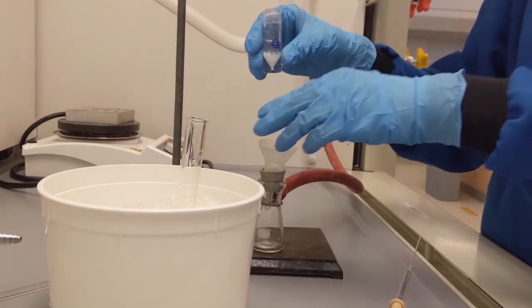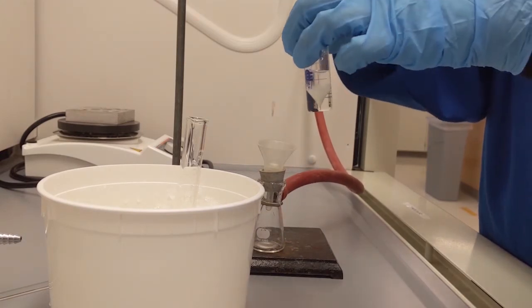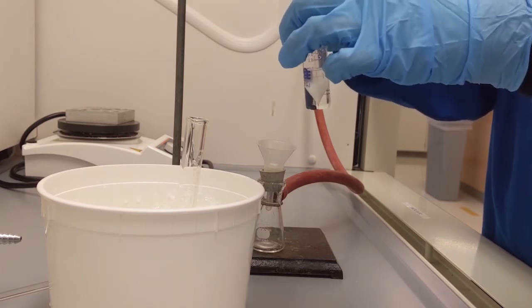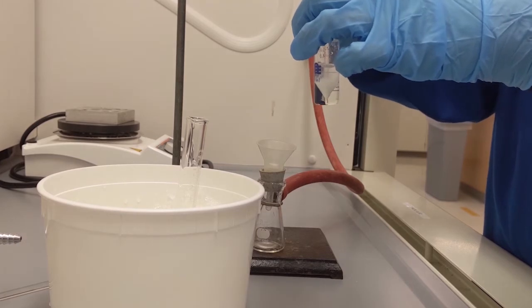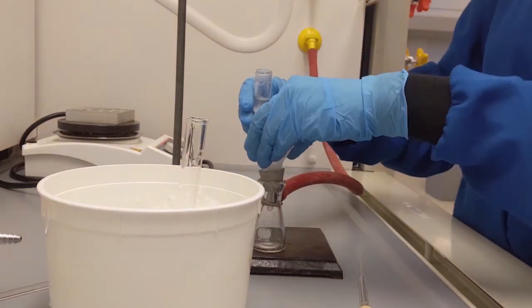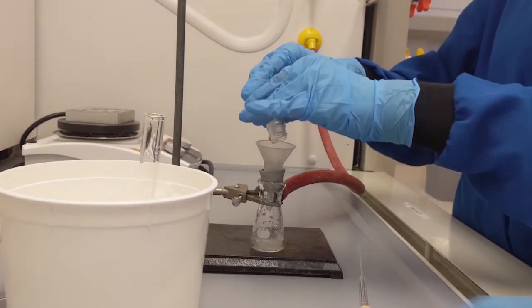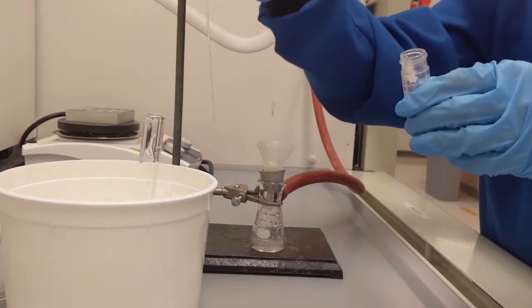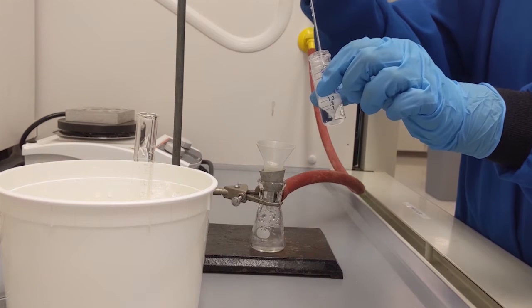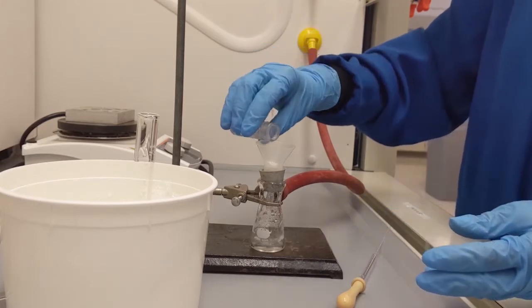Proceed to collect your white solid by vacuum filtration. The filtration setup is prepared as was done in the previous experiments. Make sure to clamp it to a stand. You may want to wash your conical vial with ice-cold water a few times, with an extra of 1 milliliter ice-cold water to collect all the crystals remaining in the conical vial.